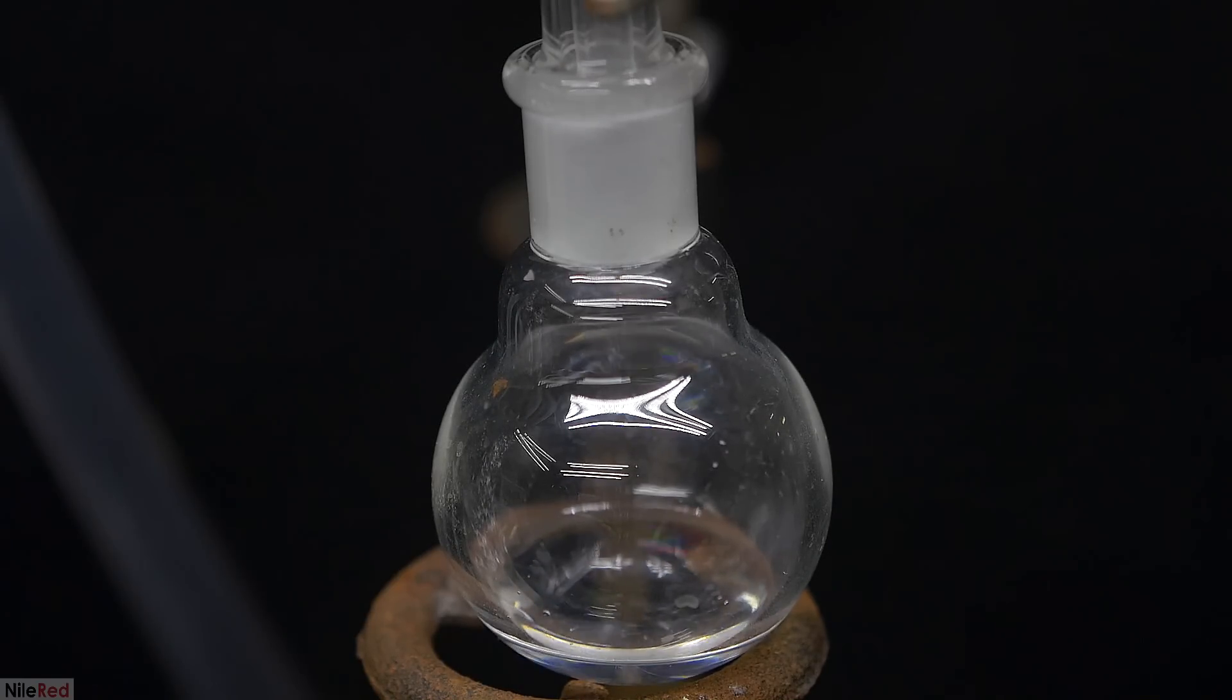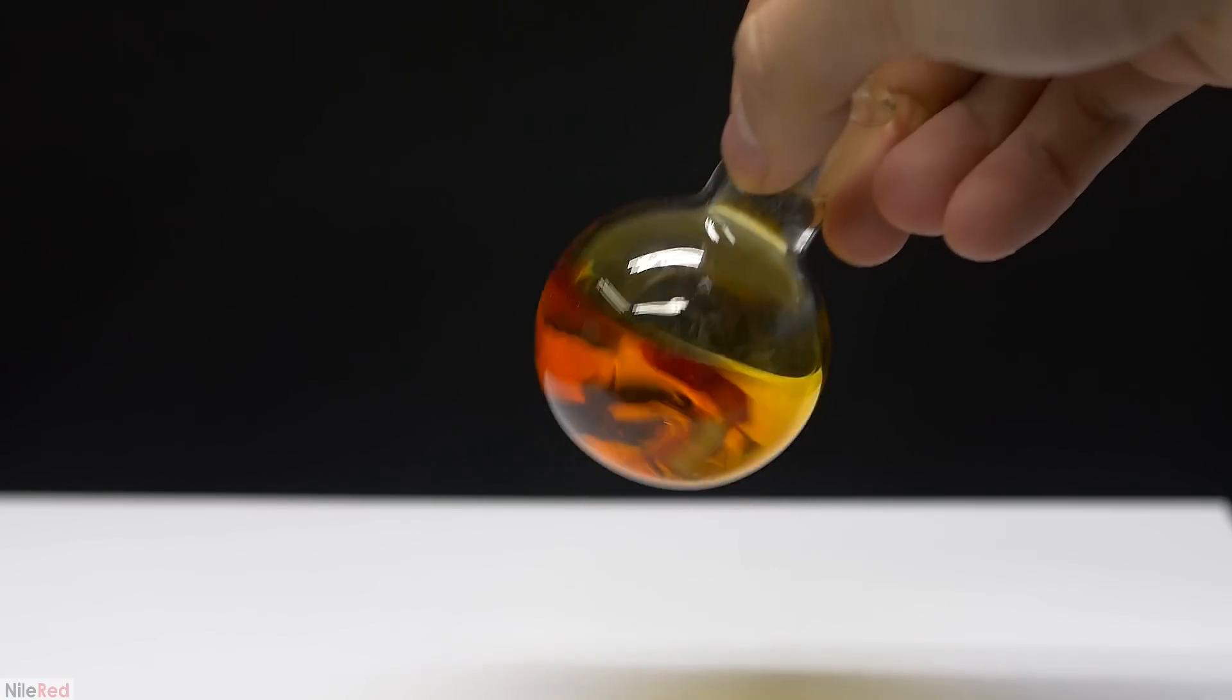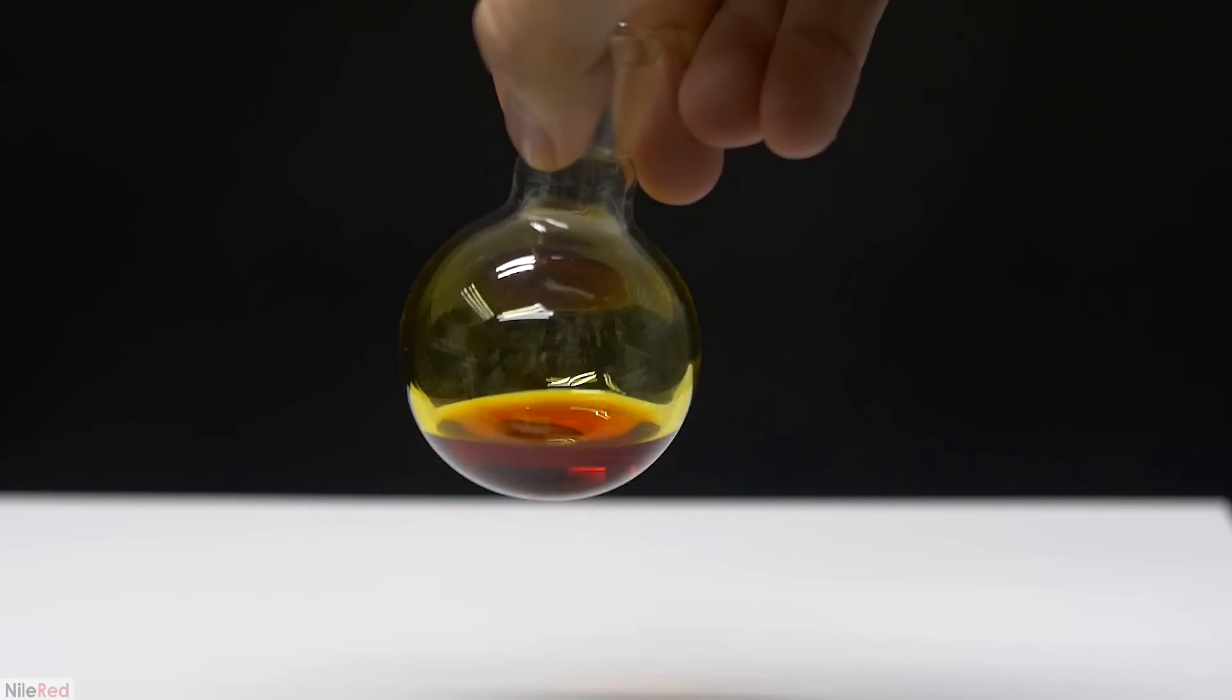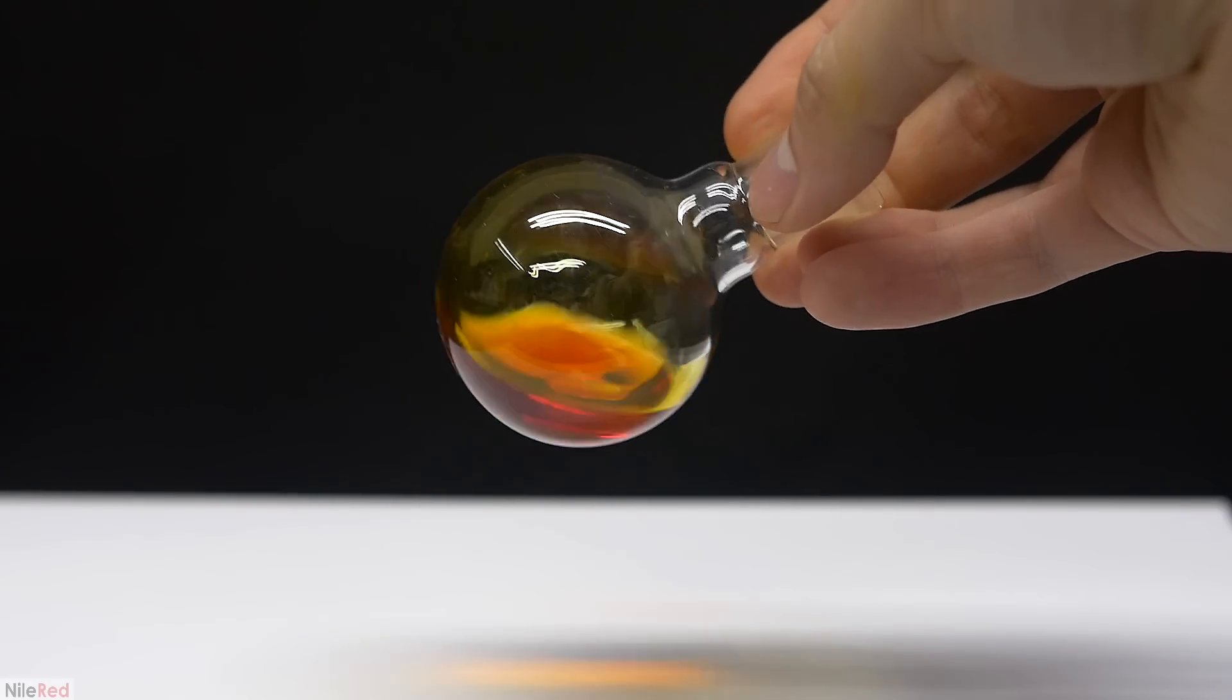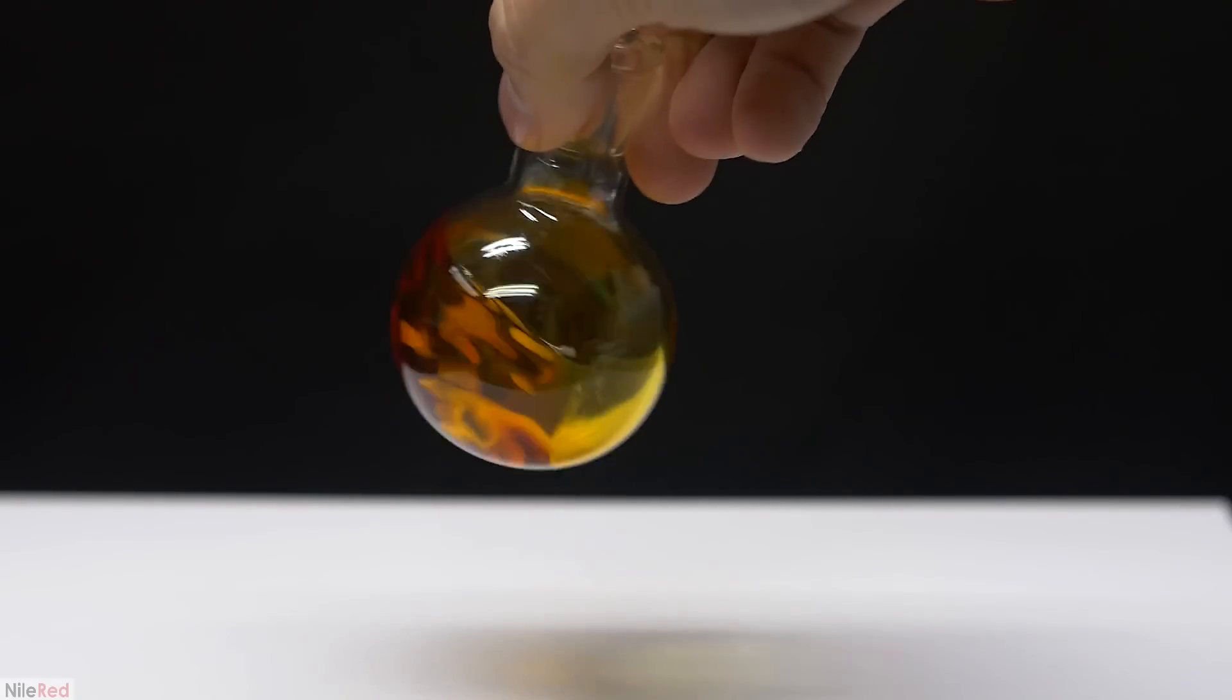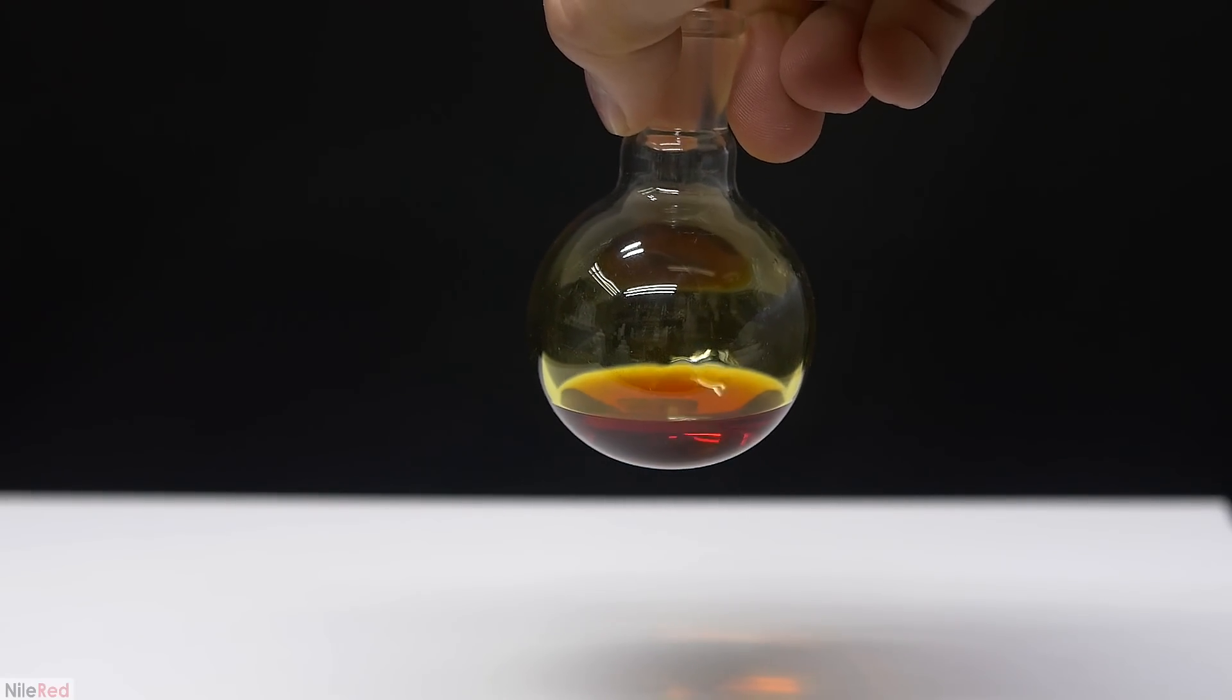When the temperature increases, it means that we're going to start distilling cinnamaldehyde, so I quickly stop the distillation. When I look at the distillation flask, we have a nice red oil and this is mostly cinnamaldehyde. In theory, I could have also purified this as well, but I didn't really have a use for cinnamaldehyde, so I decided not to spend my time doing that.